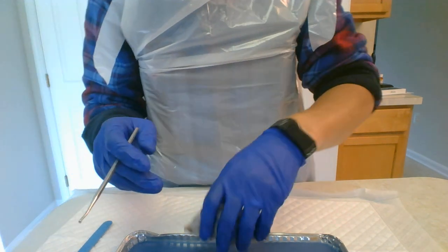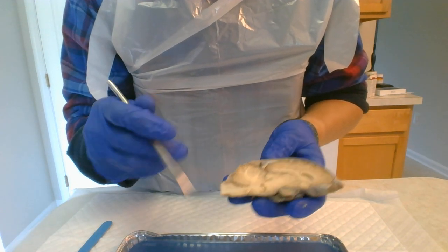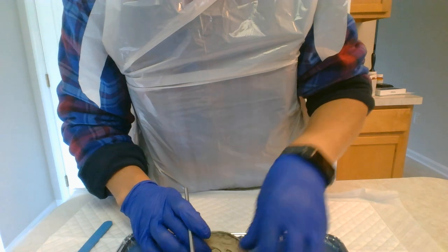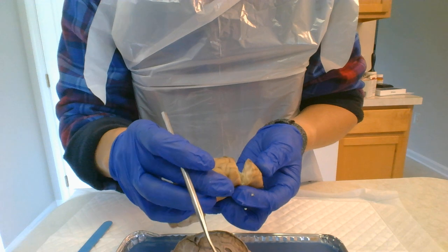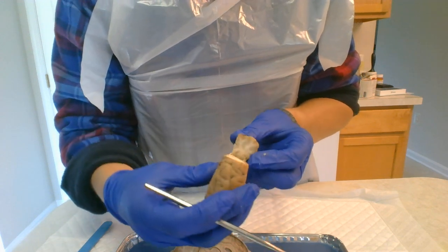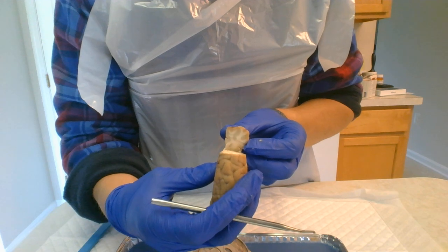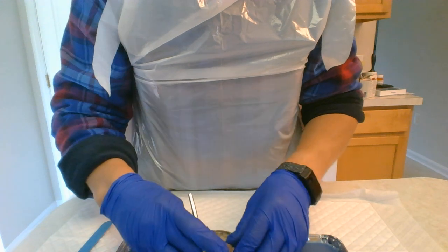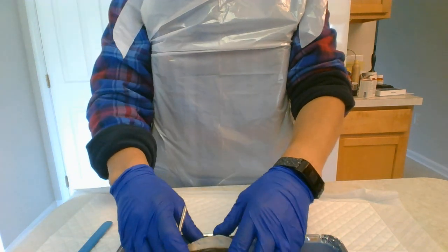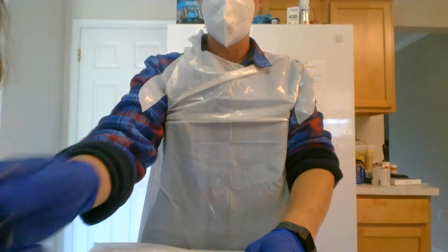And lastly, here is the spinal cord. I dissected the front portion so you can see the white and gray matter of the brain. And that concludes my lab on the structures of the brain.